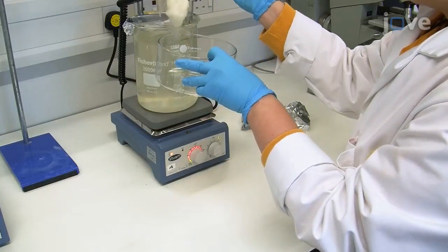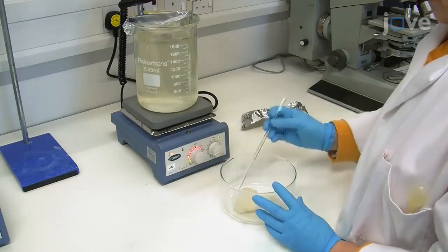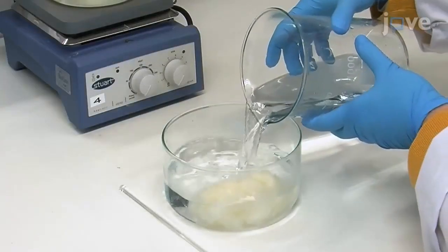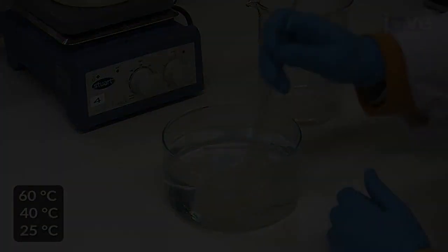After 90 minutes, remove the extracted fibroin fibers from the sodium carbonate solution with a glass rod. Wash the fibroin fibers 3 times with 1 liter of preheated deionized water, gradually decreasing the temperature.